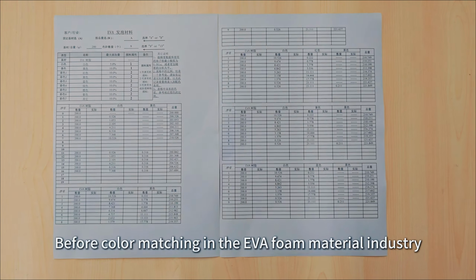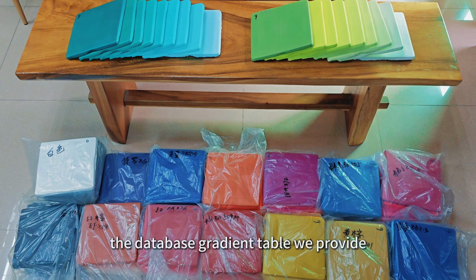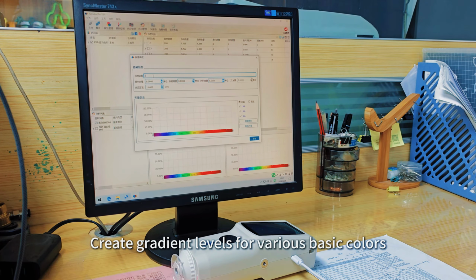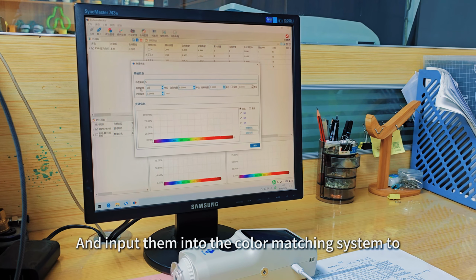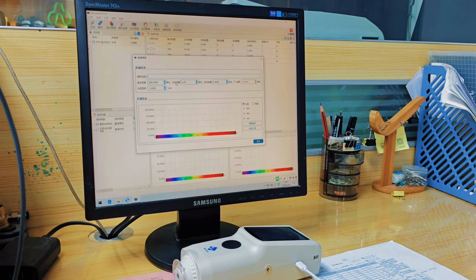Matching in the EVA foam material industry should be based on the contents of the database gradient table we provide. Create gradient levels for various basic colors, and input them into the color matching system to complete database establishment.